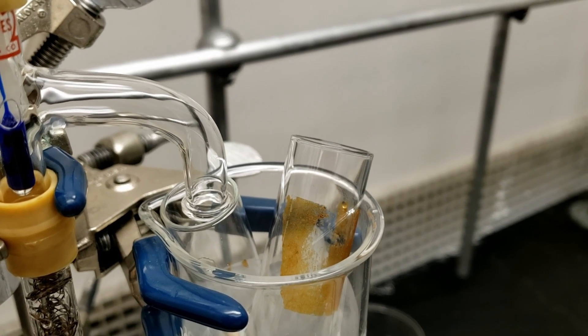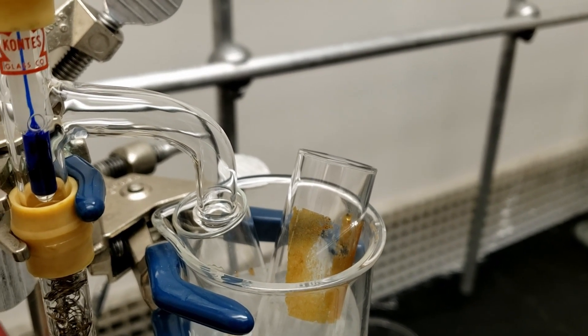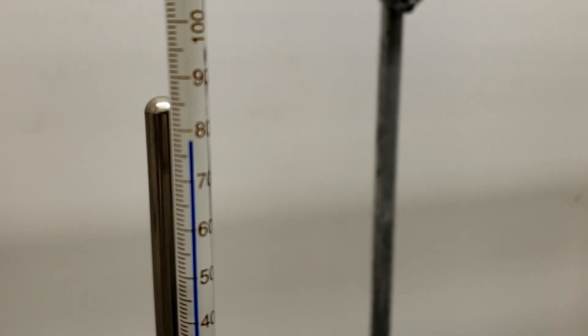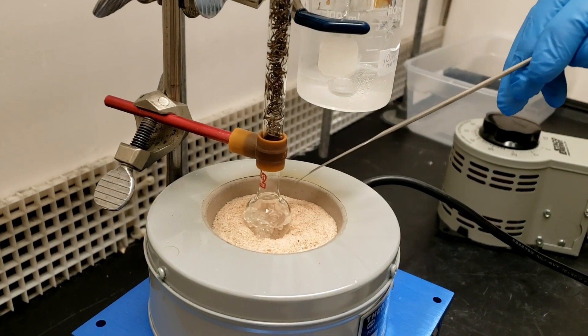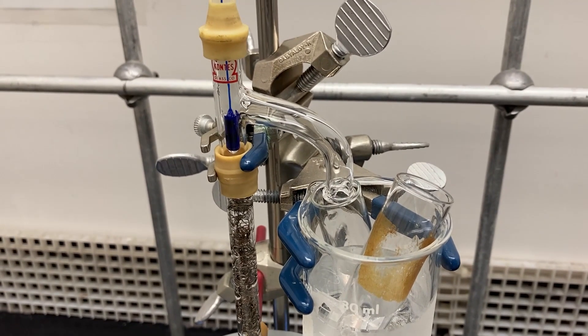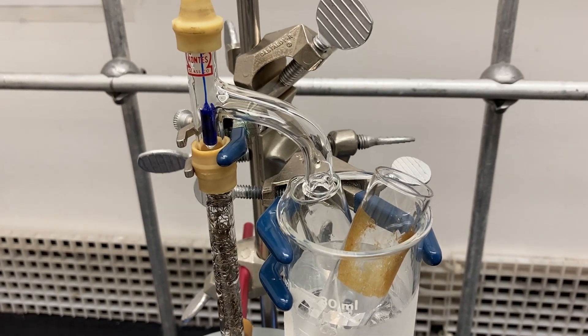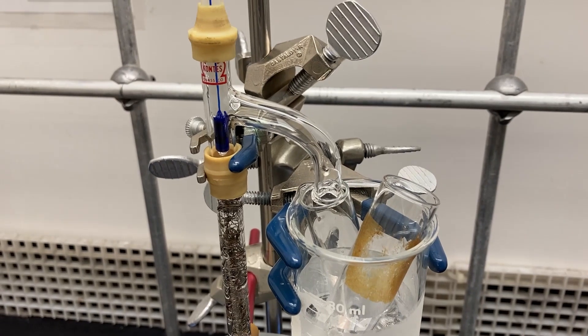Now we begin to see our liquid distill. Here we see our first drop come off the distillation apparatus. Use this thermometer reading as your first data point. If the drop rate is too fast, remove some of the sand from around the flask. Continue recording the temperature after every five drops. During this section of the video, make sure you record the temperature every time the camera pans to the thermometer.